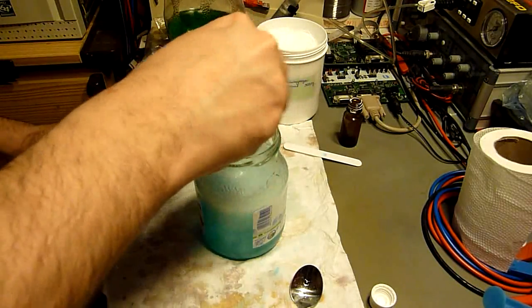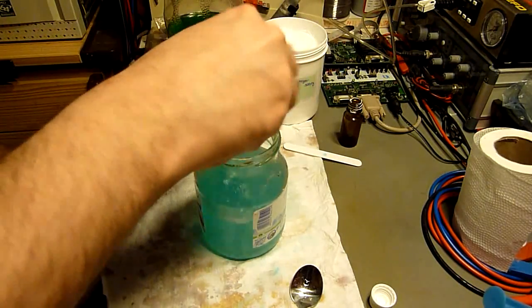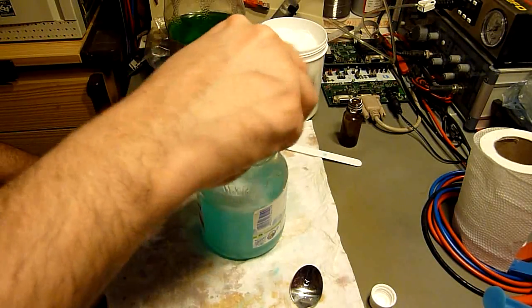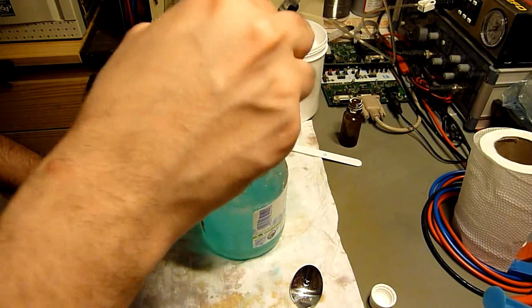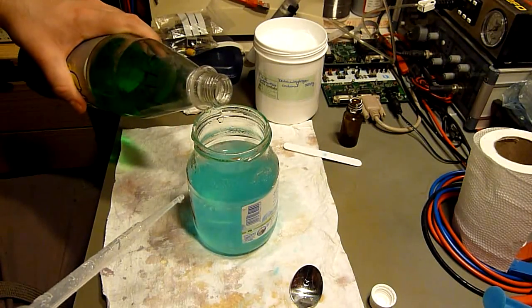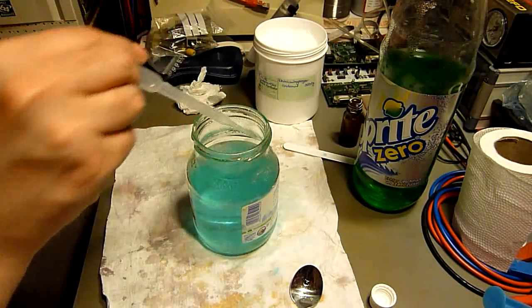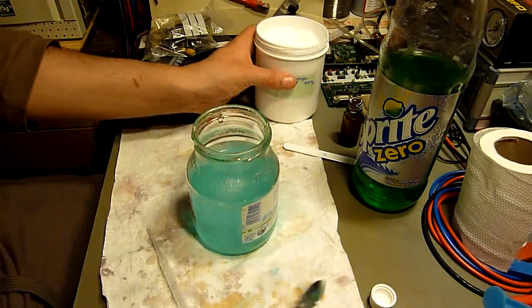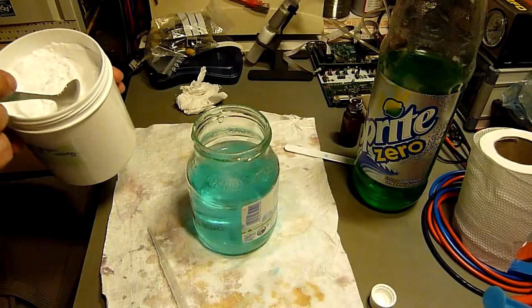If you are not careful, this is what might happen. Now we have destroyed the harmony in there, because we need the copper to fall out, and now it's in the solution again. Too much of the acid.